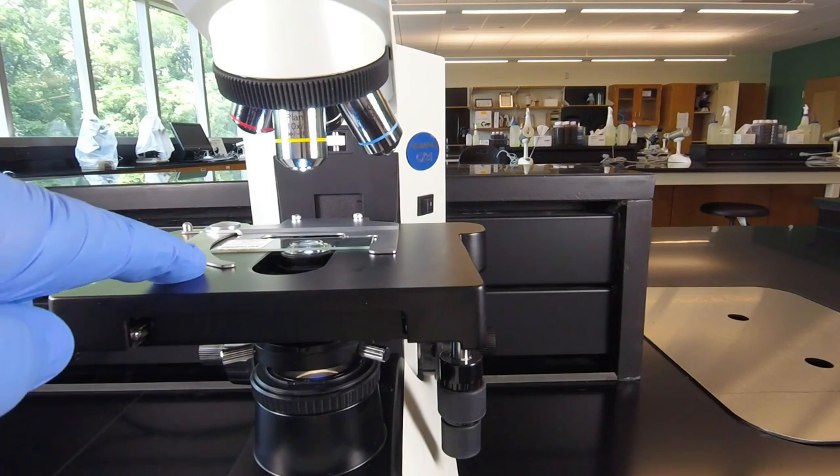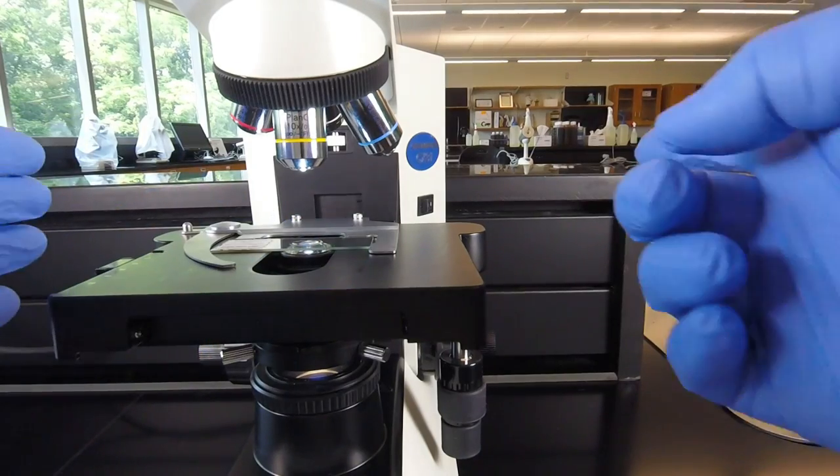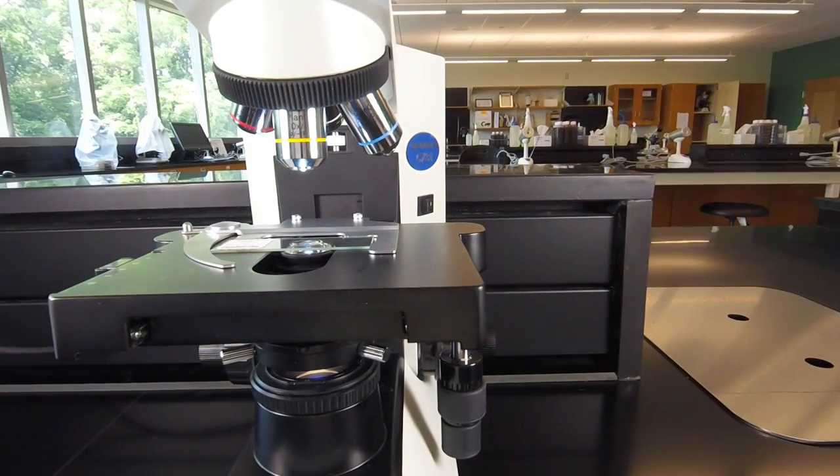Notice you don't try to put the slide under this like you do spring clips, but rather put it flat on the stage so the slide is being held by the two sides of the slide holder.